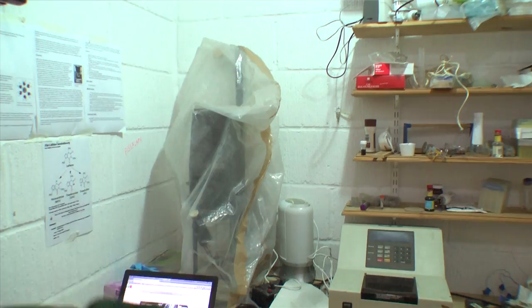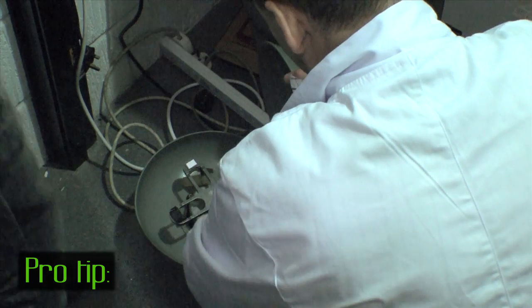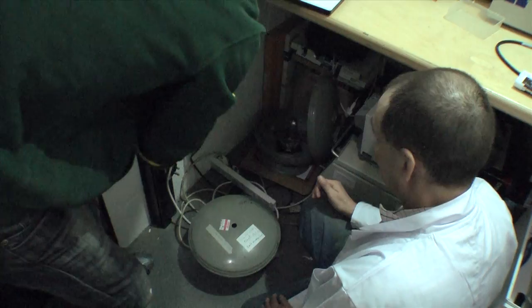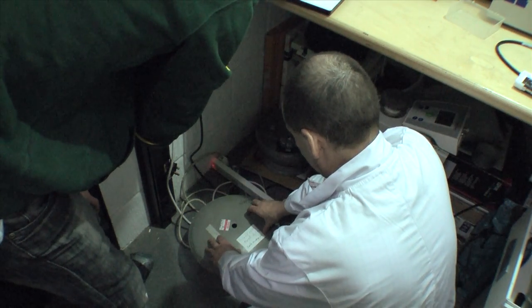Where is it? Is it balanced? Oh, you didn't balance it, did you? No, I forgot to balance it. Sorry. Is that leaked or is there still some in there? No, there's still some in there.